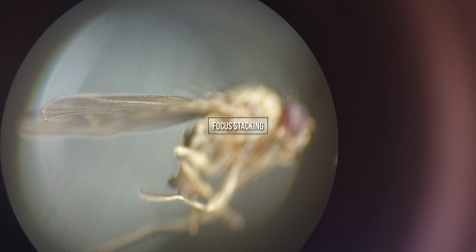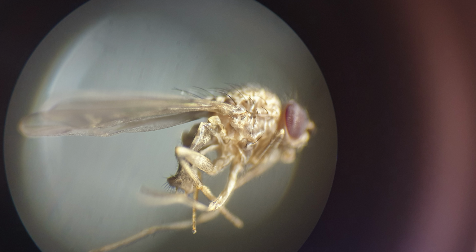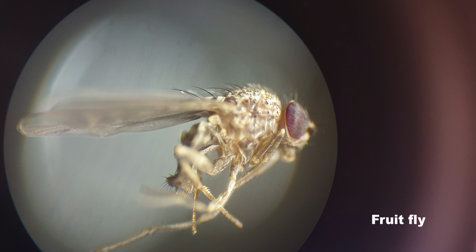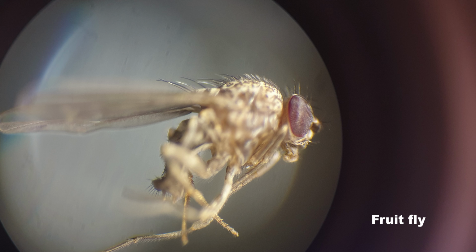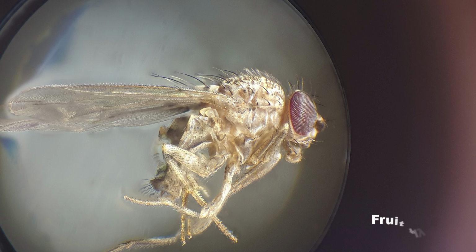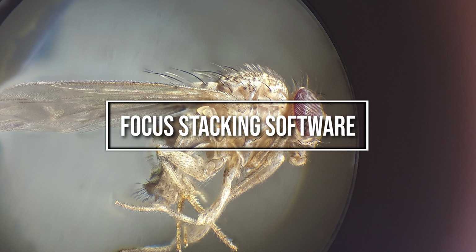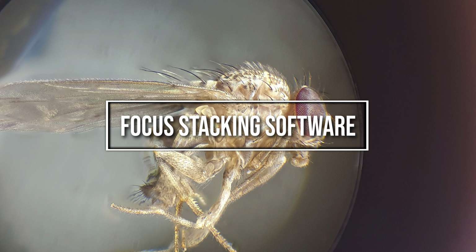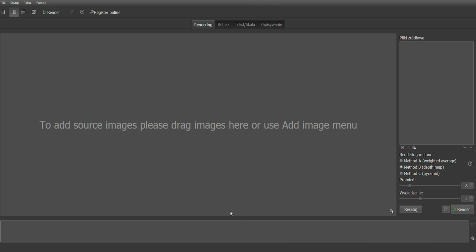The solution to this problem is focus stacking. It's a technique where we combine multiple photos of the same scene, each taken with a different focus point. This allows us to create a single image that's sharp from front to back. So, what software is worth checking out if we want to create one image from multiple focus layers? I'd like to start with one of the most popular options, Helicon Focus.